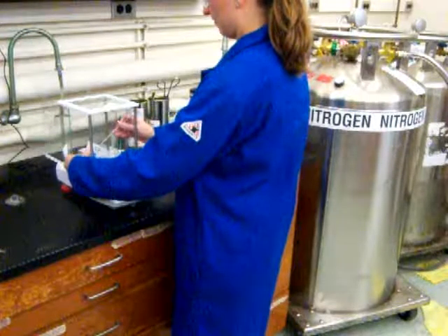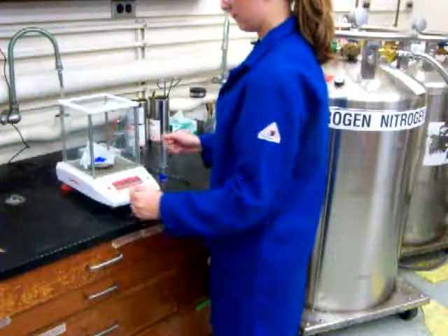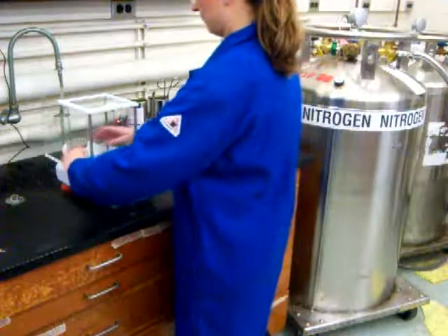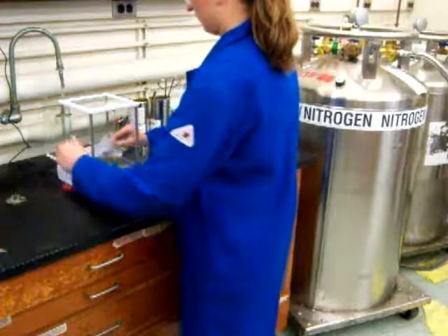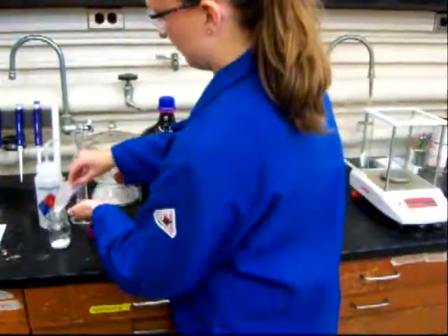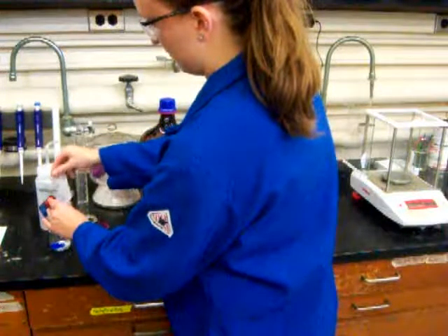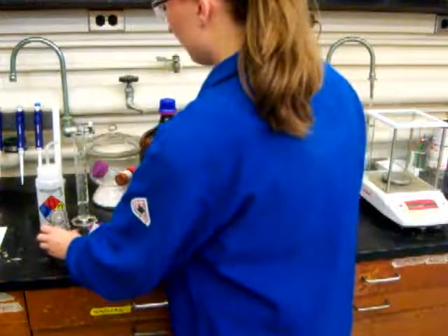And you can see here, Katie is measuring out the correct amount of the copper nitrate salt. And she double checks to make sure that the reading is right. And now she's going to use the weigh paper to transfer the copper nitrate to a glass jar. And the glass jar already contains our trimesic acid, so we have both solid ingredients in the container that's going to be used to run the reaction.